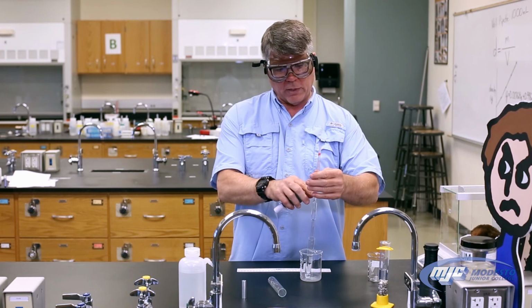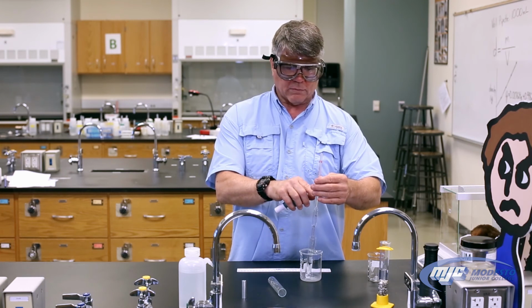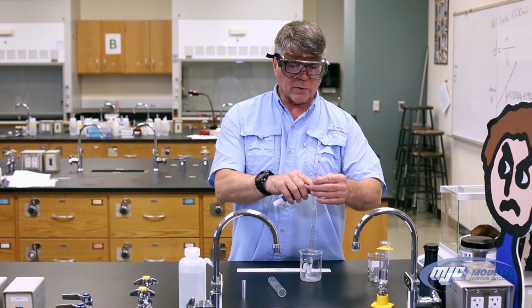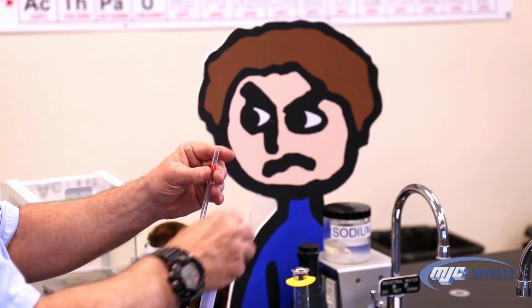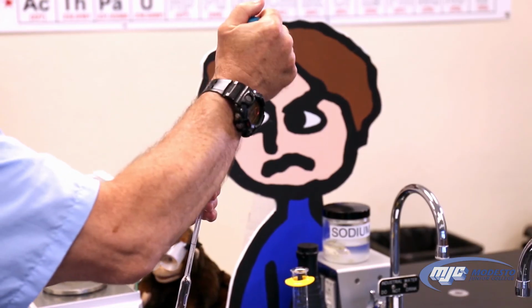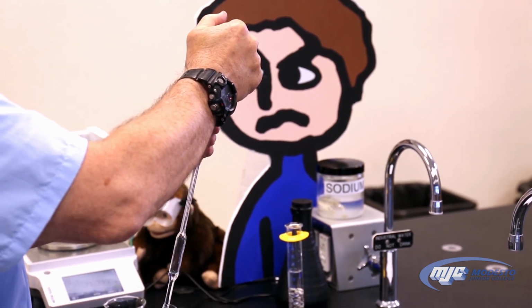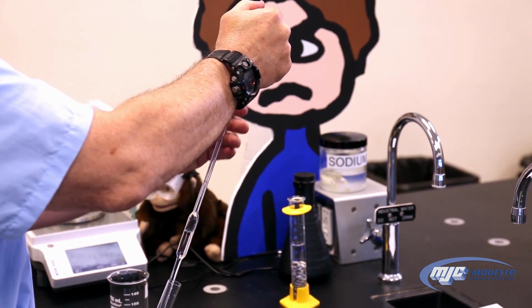And again, remember there is a mark up here. It's going to be somewhere, they're all different, on this top part of the pipette. You want to bring the solution up above it and then let it go down until the bottom of the meniscus just touches the top of that line. So squeeze the pipette bulb, leave it squeezed, put it on there. Don't have to jam it on, just let it seal. Pull up the solution above that line. My line is right there, so I'm going to pull it up here somewhere.